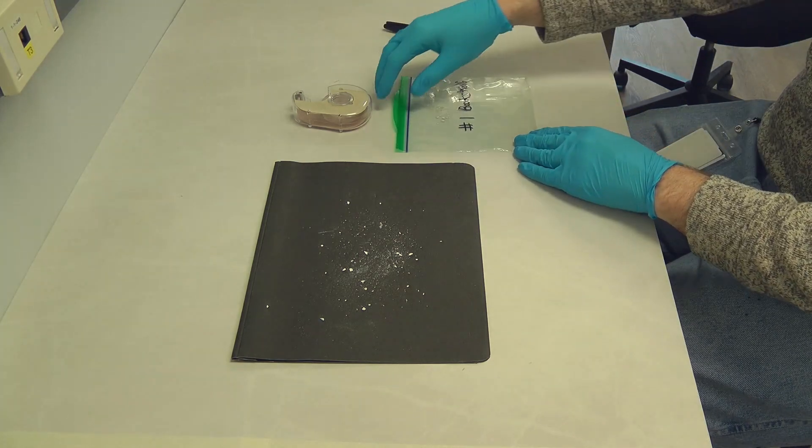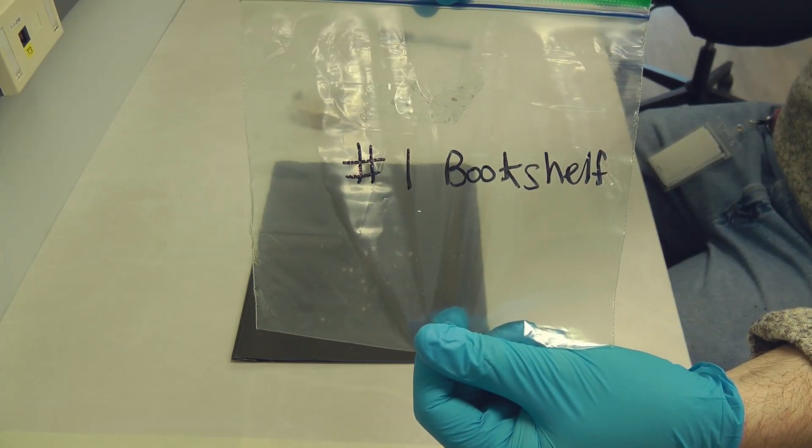Write down on the bag the location of the sample taken, for example sample number one, bookshelf.